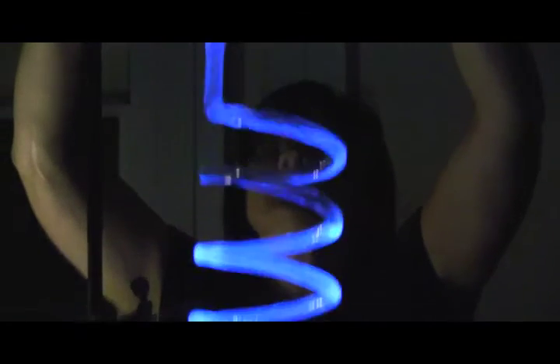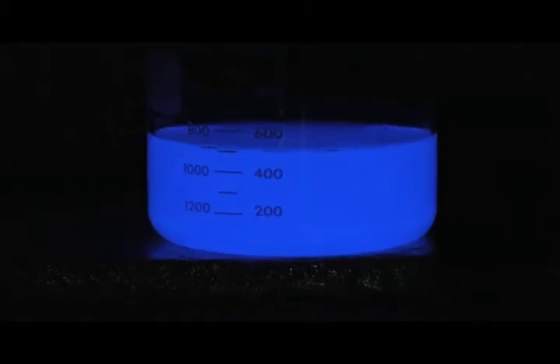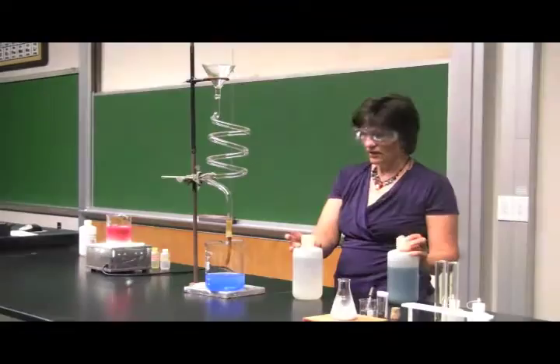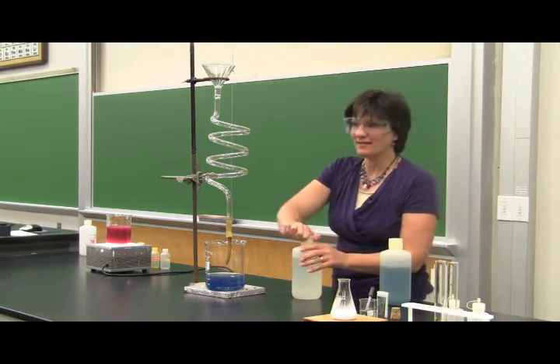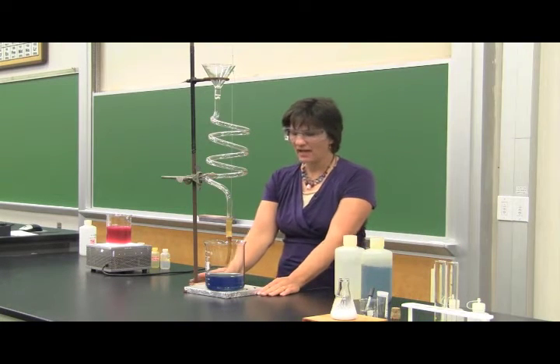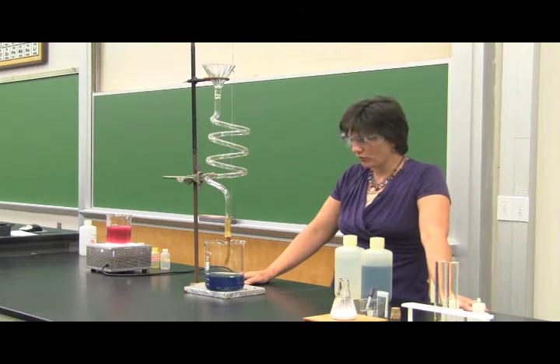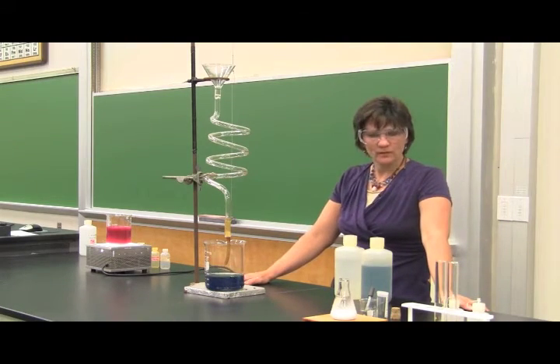Oh, a little bit more because that's just so much fun. Okay, so we definitely see the blue color. As those reactants do their reaction, we see a blue color. Now this is something we can see in fireflies at night. There's a chemical reaction that takes place in their bodies that produces light, sort of like that. And you experience those with glow sticks, maybe that you've bought at a carnival or at the zoo or someplace like that.